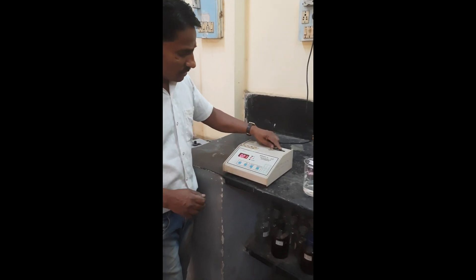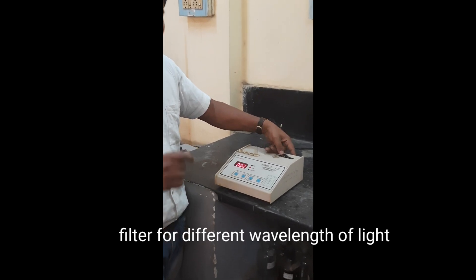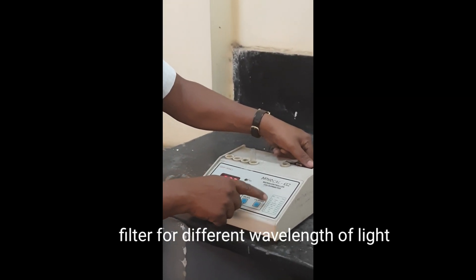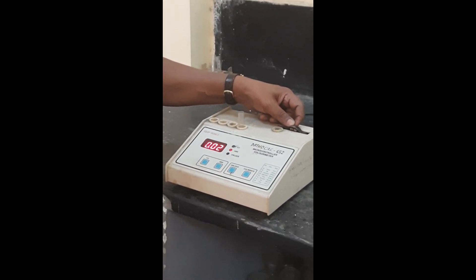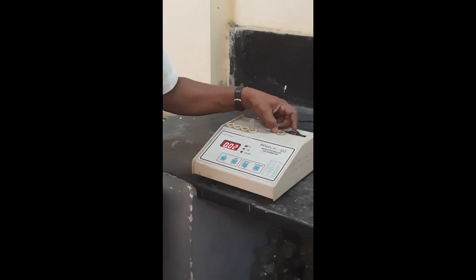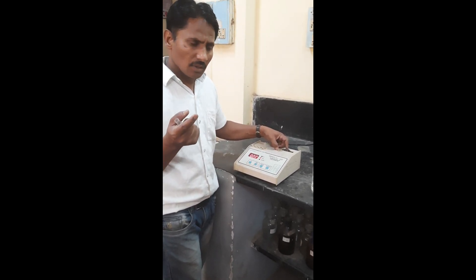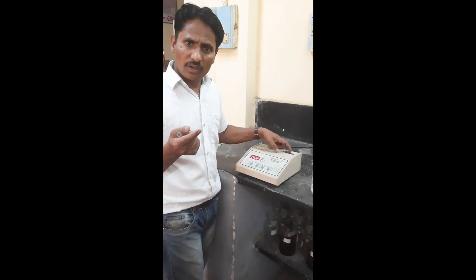This instrument has a knob filter — this is a filter. There are different filters, and the wavelengths are written here. This filter helps to pass a particular wavelength of light through the solution. Every solution has the tendency to absorb a maximum wavelength of light — different wavelengths correspond to different colors.